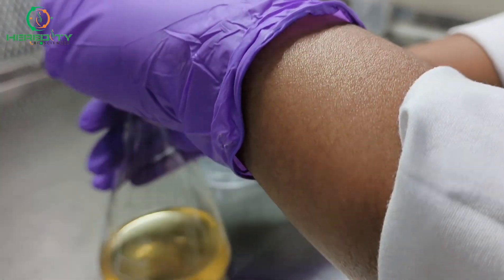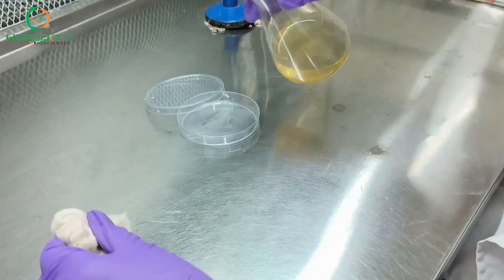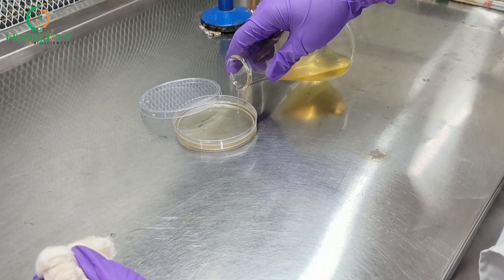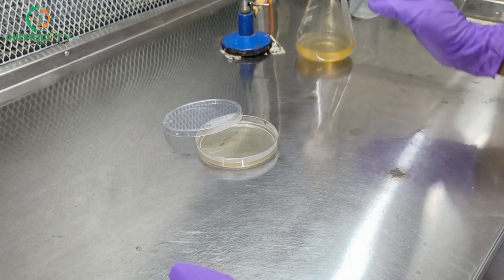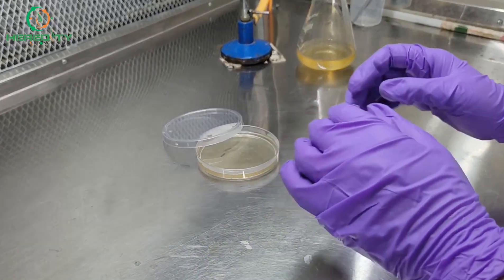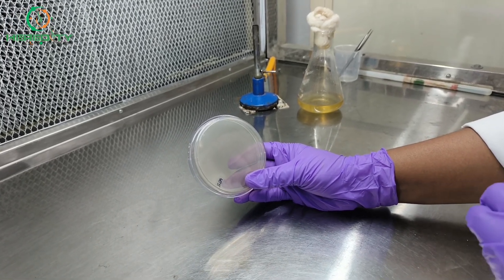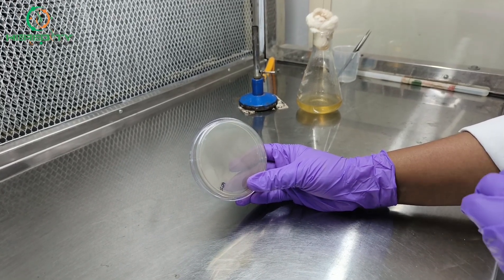After autoclaving, we will pour the media into the petri dish. Let's leave it for some time for solidifying. After solidification, we will pour the media — now our plate is ready for fungal growth. Now our SDA plate is ready. The high sugar content in dextrose and the low pH of the medium create an inhospitable environment for bacteria, making it a fungal paradise.